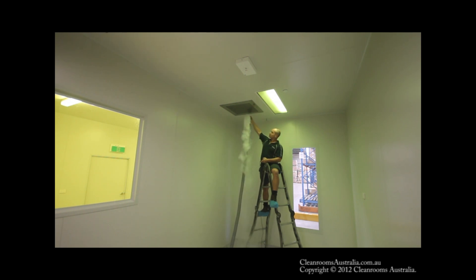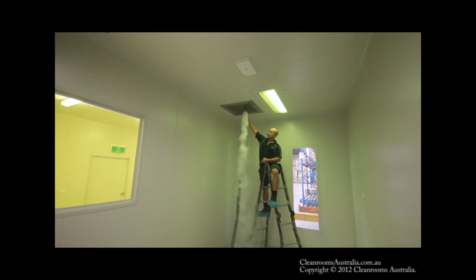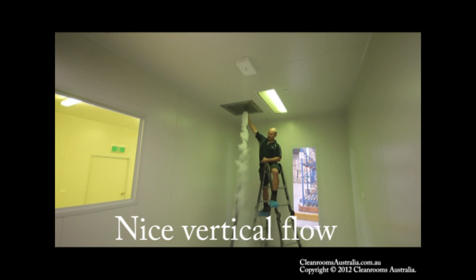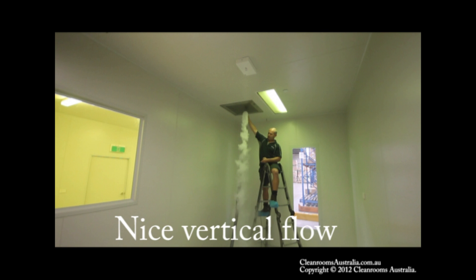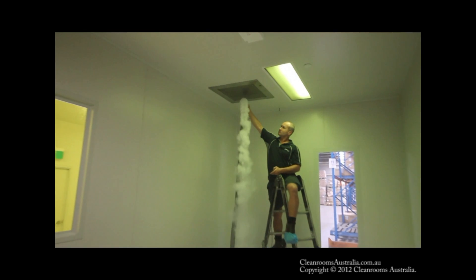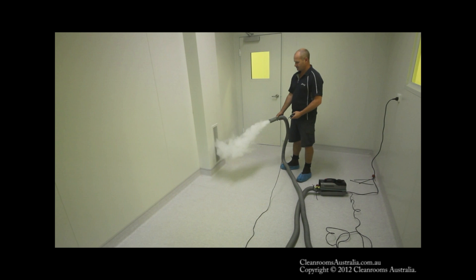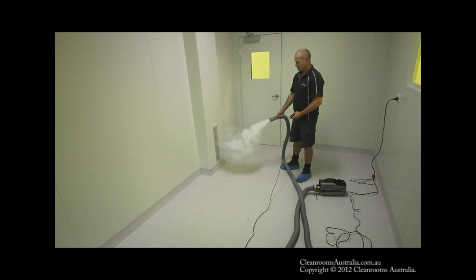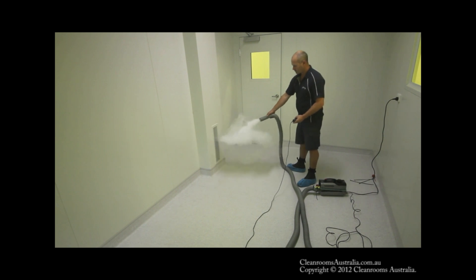There is some laminar flow within this clean room which is coming directly out of the HEPA filter, positioned directly above a production area, once the machinery is in place. You'll notice we've turned the lighting down to get some shadows on the walls, and we're using a nice crisp white smoke at a high density.